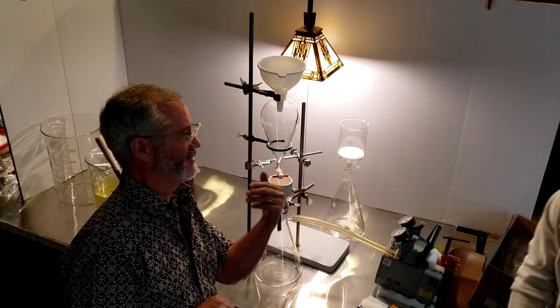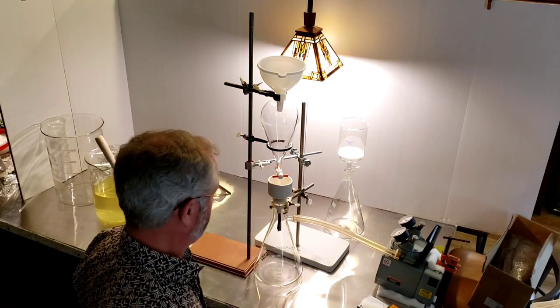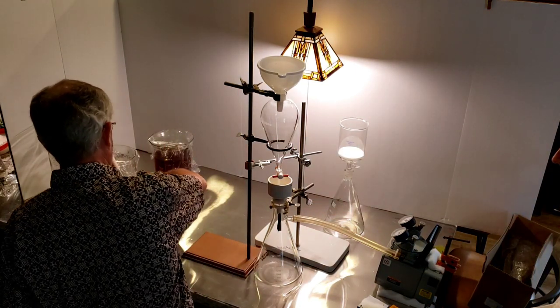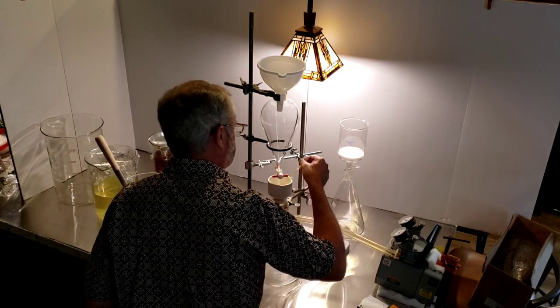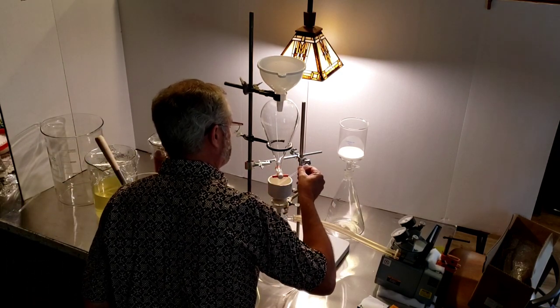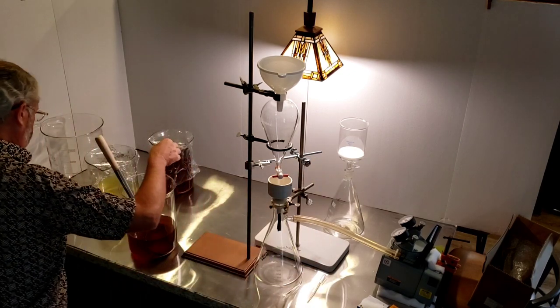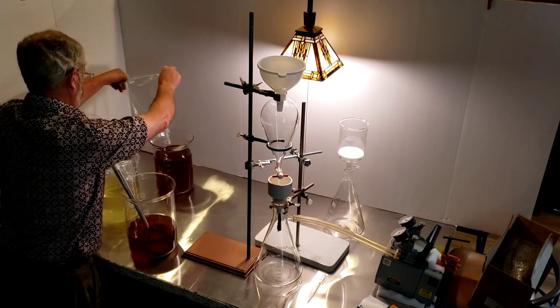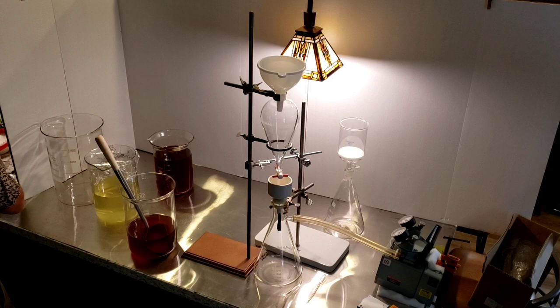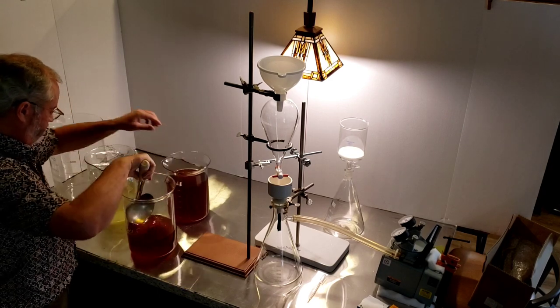He's going to supervise because I've never done this before, never set this up before. Our first step is to wet our little filter paper in there on top of the funnel. Then I'm going to pour some into the separation funnel, because it's got a stopcock to determine the inflow rate.